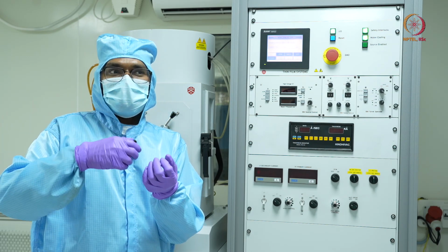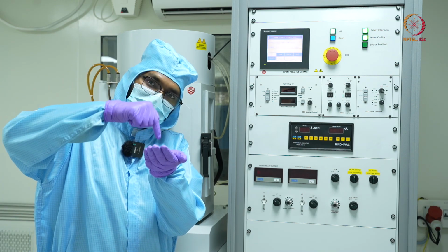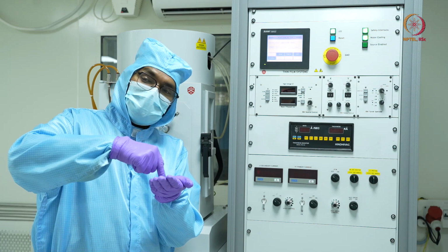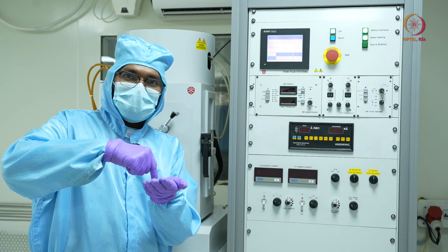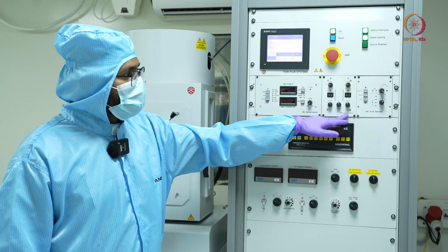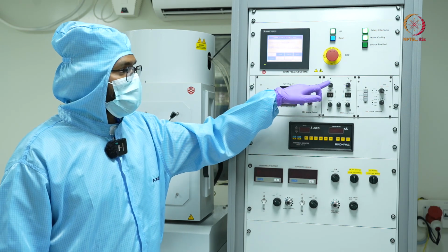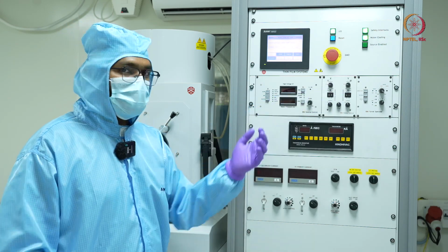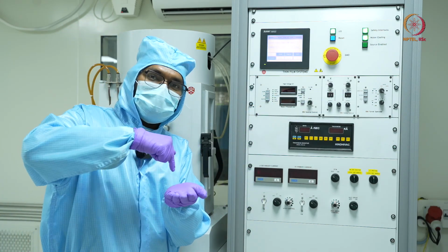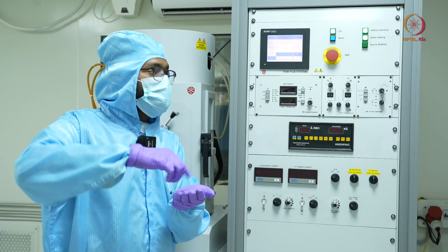So what happens due to this is, rather than the heating taking place only at a single point, a larger area is covered and we get a more uniform heating. So for that we have the sweep control, where we have the control for X and Y direction amplitude. These two knobs are for controlling the amplitude, that is, from the mean position, how much till extreme it will go, how much it will go in X direction and how much it will go in Y direction.